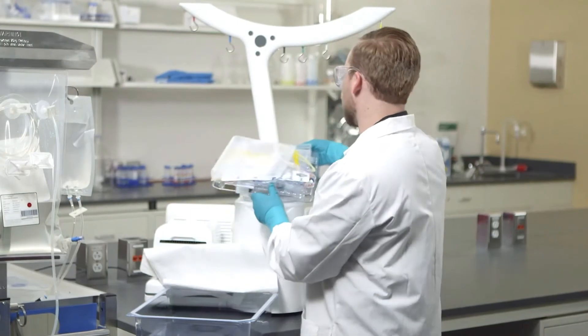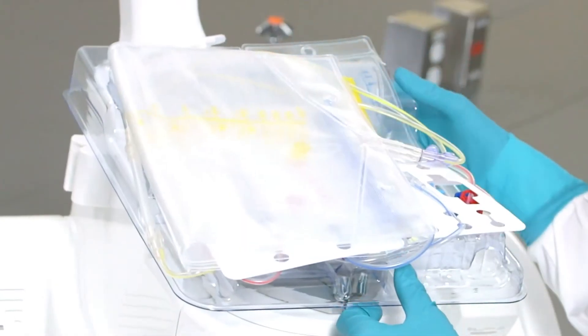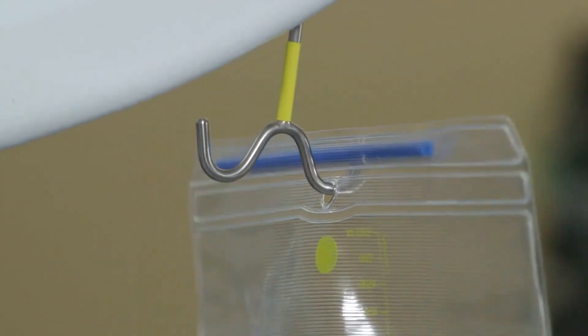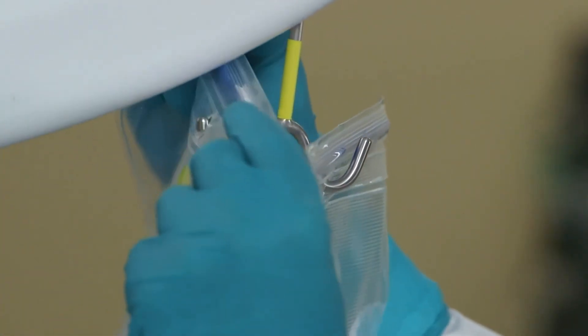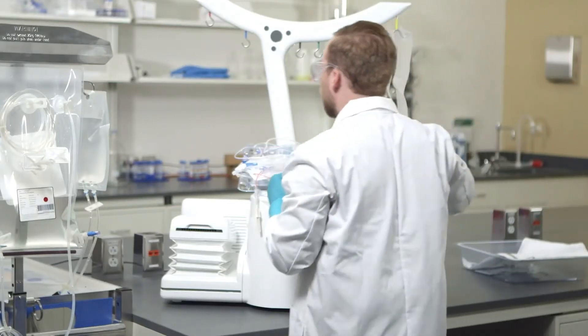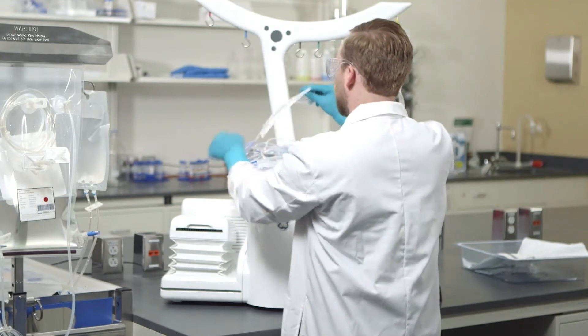Continue installing the kit, following the order by which the bags are accessible from the packaging. The instrument is equipped with color-coded hooks to simplify the installation process. A diagram on the central stopcock helps in identifying each of the eight independent fluid paths.